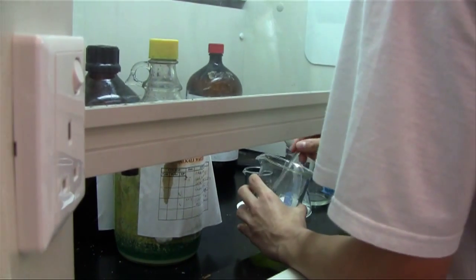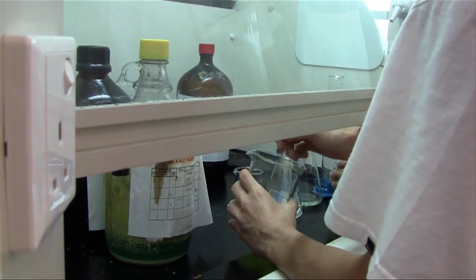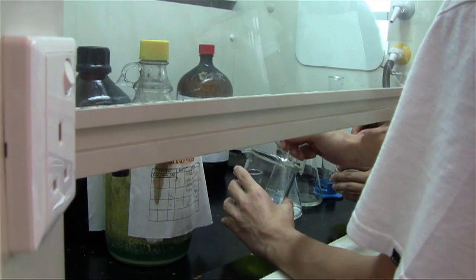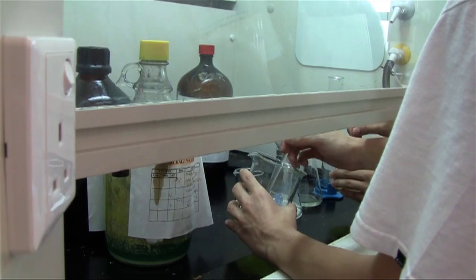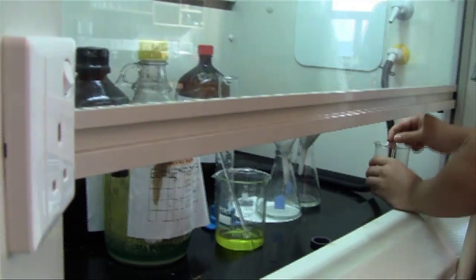In our experiment, we will also add 5 milliliters of oleic acid to be our surfactant. A surfactant holds onto an iron particle at one end and an oil or organic solvent at the other end.